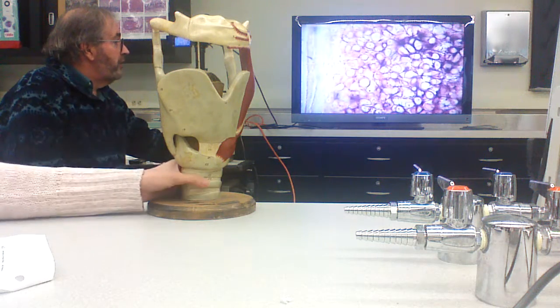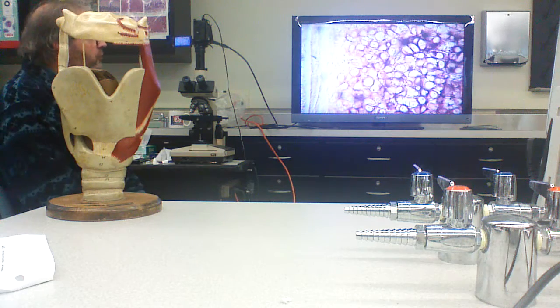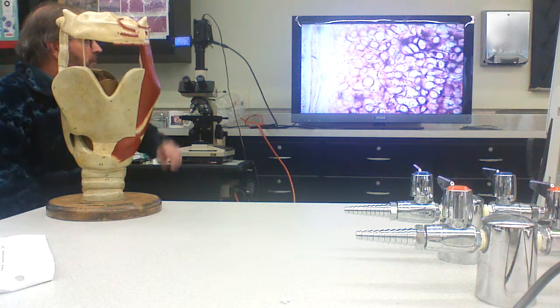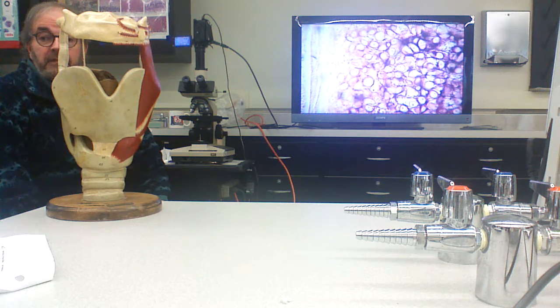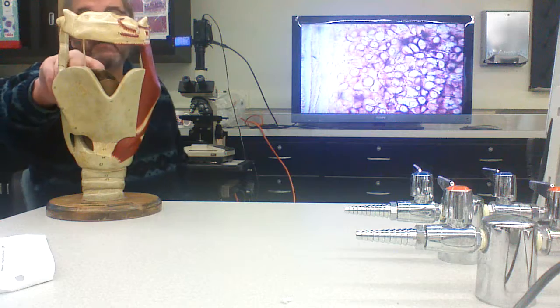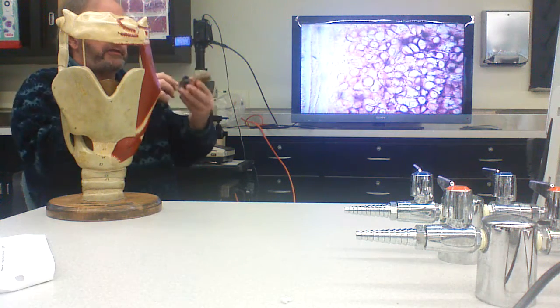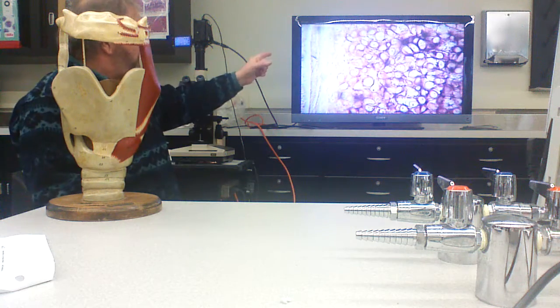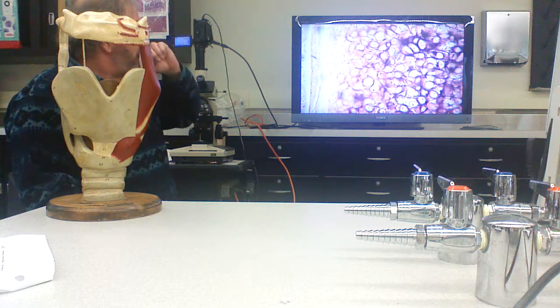But you can see that there are cell nests, and you're staining typically with elastic orcein, which is kind of bluish black, the elastic fibers. Right? So in fact, if you cut through the epiglottis, the center is going to be elastic cartilage. That's what it looks like, because that's the elastic cartilage of the epiglottis.